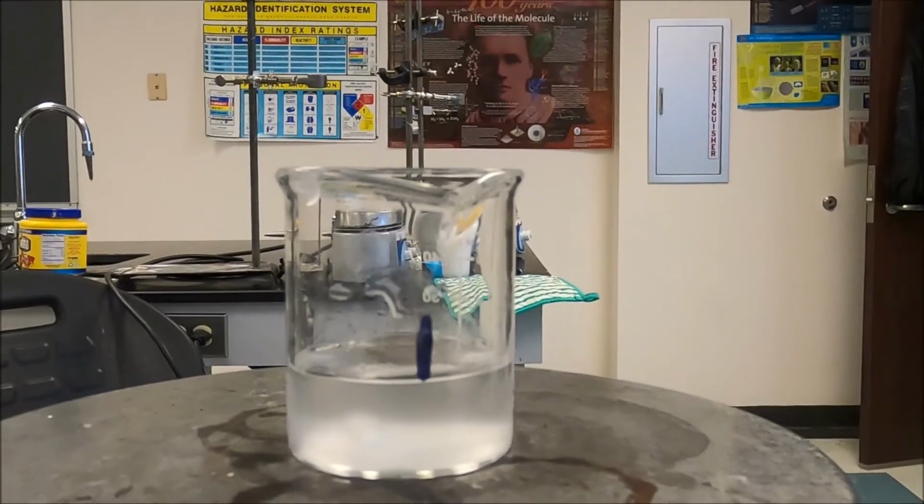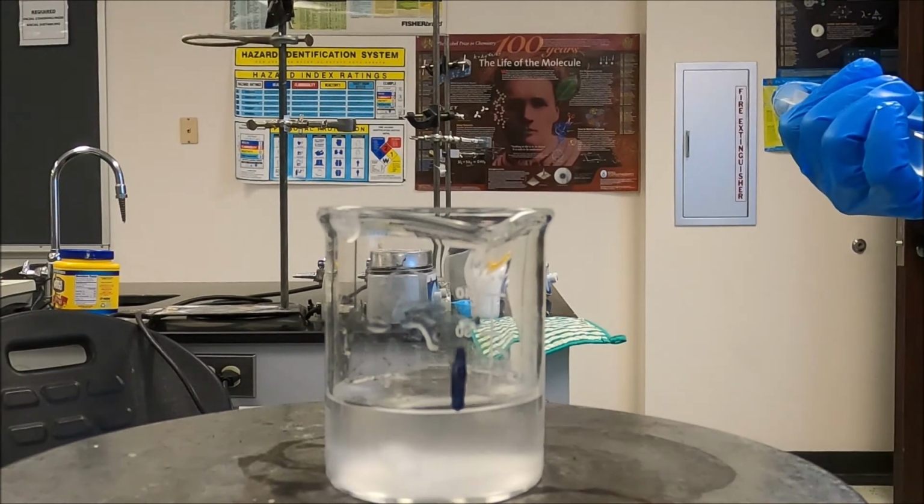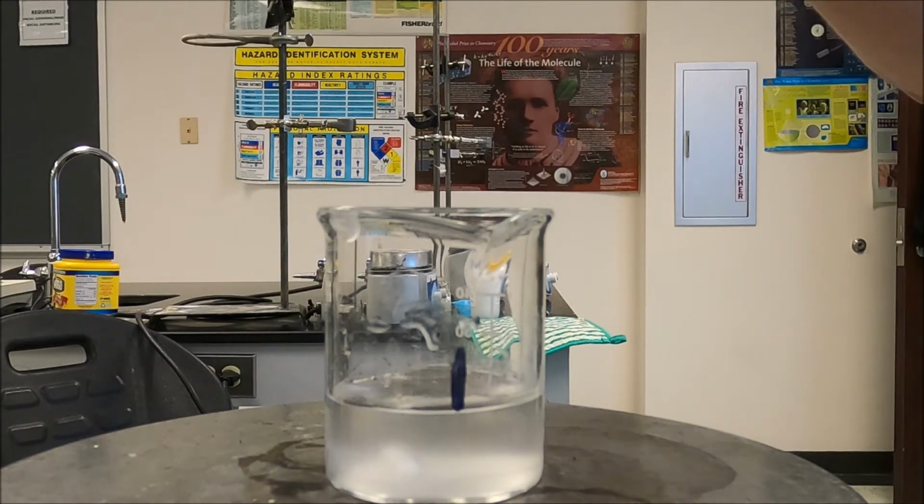I want you to look at this beaker, go grab your cell phone and have it on your stopwatch function. Okay, because you're going to time this. I'm doing the same thing with mine. I'm going to collect the data just like you, but I'm going to keep my data compared to yours. Let me find my clock. I need my stopwatch. Okay, guys, get ready. When I say go, you're going to start timing. Let me get it stirring here.